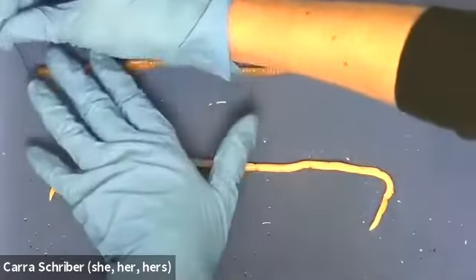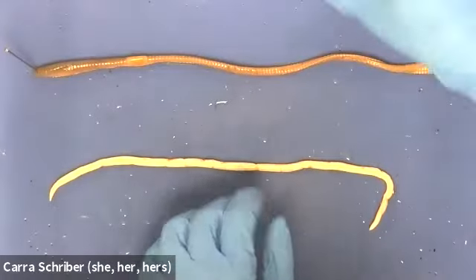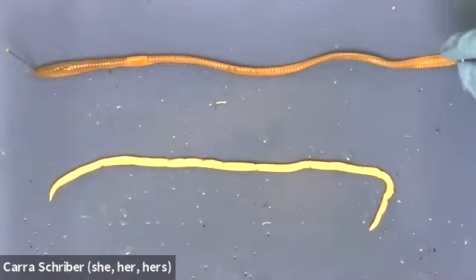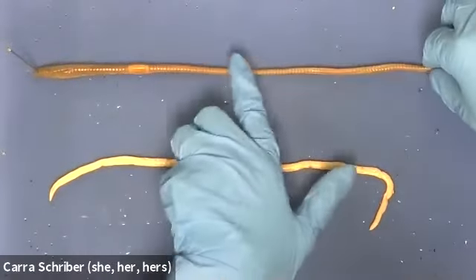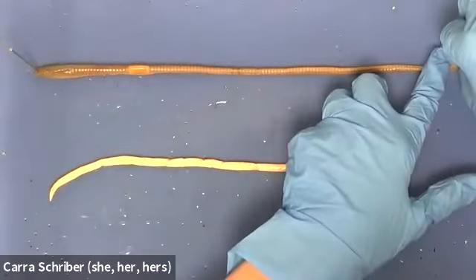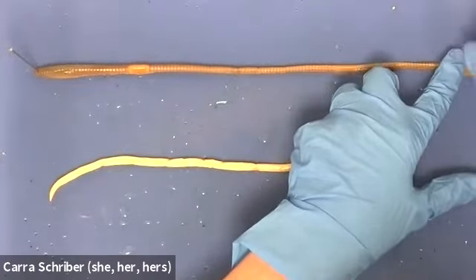So let's go ahead and pin this. Here's the head region. You can see that it's twisting in on itself, and for a dissection, that's not optimal. So I'm going to try and straighten this specimen out to the best of my ability, and then we're going to pin the tail end.